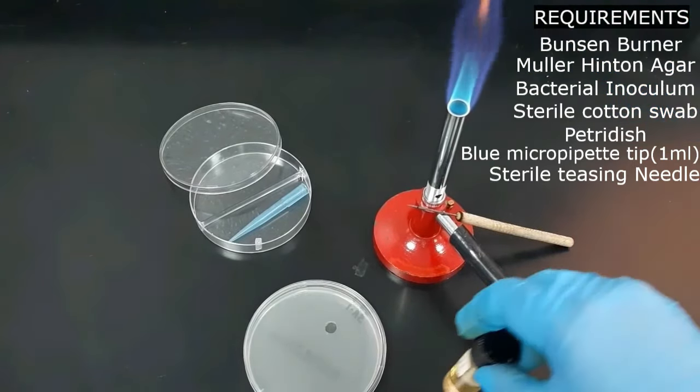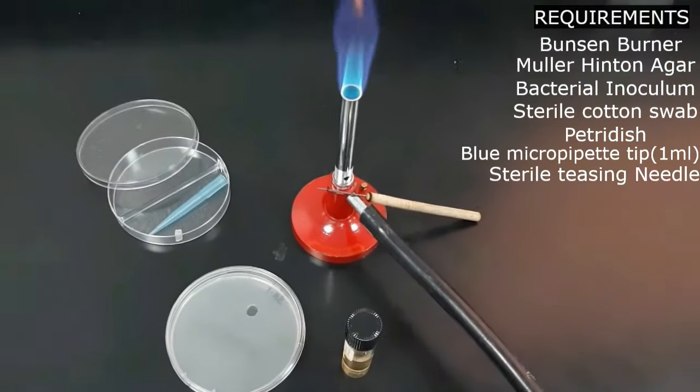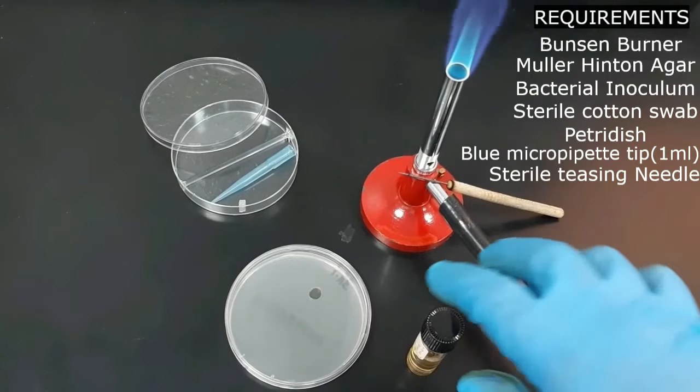Once the well is ready, seal the underside with two to three drops of melted Muller Hinton agar and wait for a few minutes to solidify.